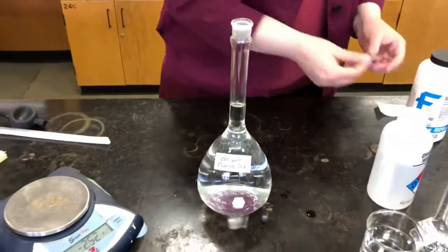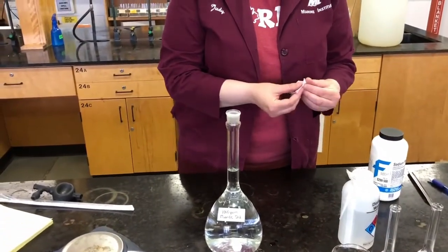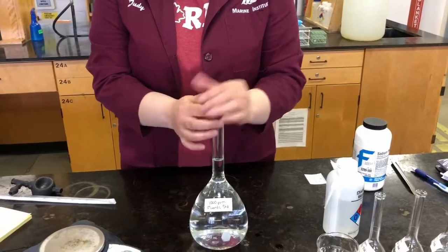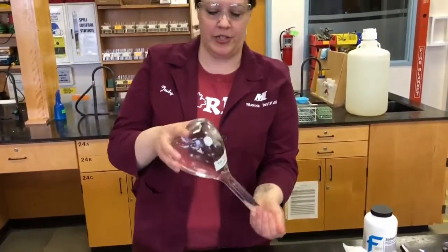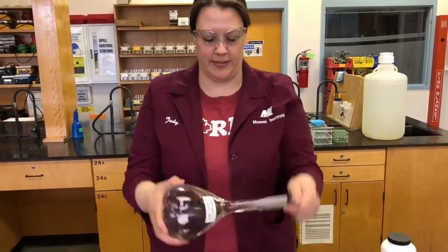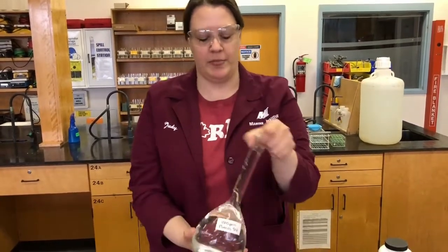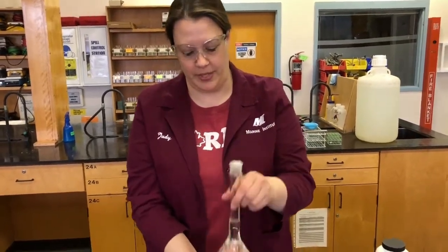So now I want to make sure that the sodium fluoride that's in there is mixed throughout the solution, that it is uniform. So I'm just going to take some parafilm and cover my cap here and cover my top. I'm going to invert it a few times to make sure that it's all very well mixed. You can do this if your powder doesn't all dissolve at the beginning too. You should make sure that your powder is all dissolved before you top it up to the line.